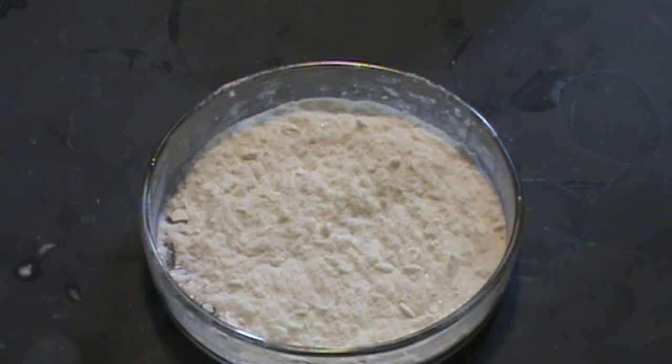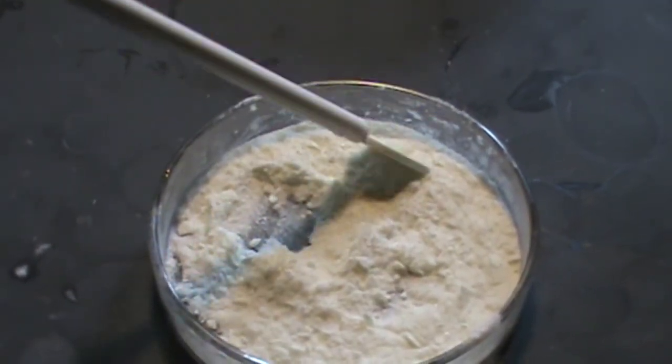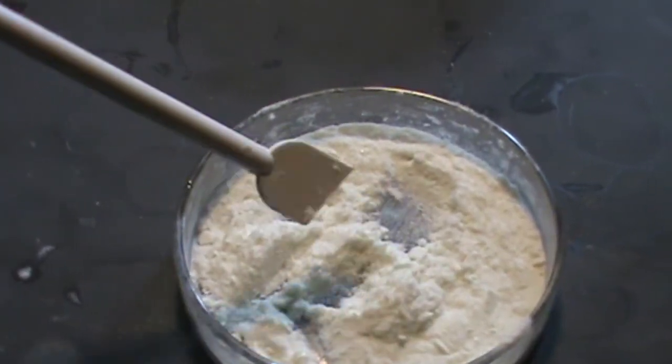A final wash with acetone is done so that the product will dry quickly. After it all evaporates, what's left is a fine, slightly off-white powder.